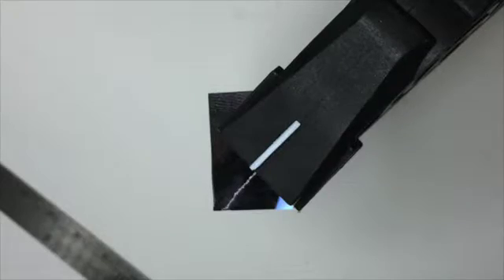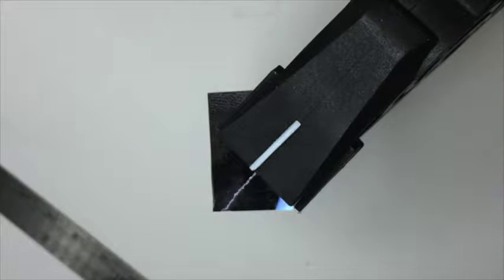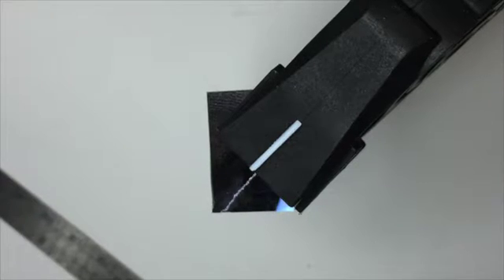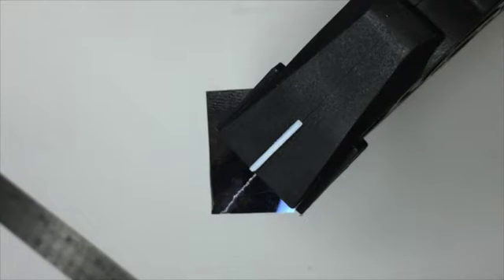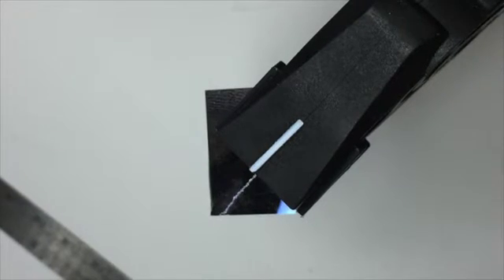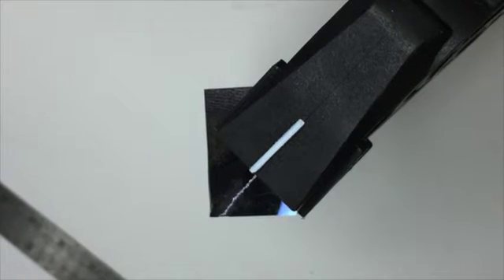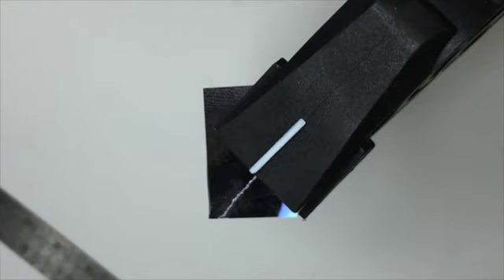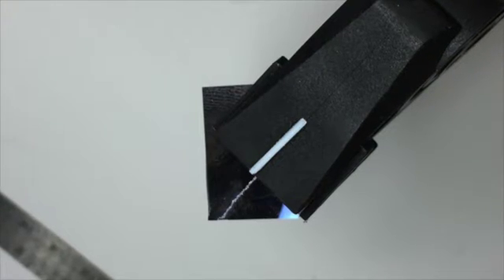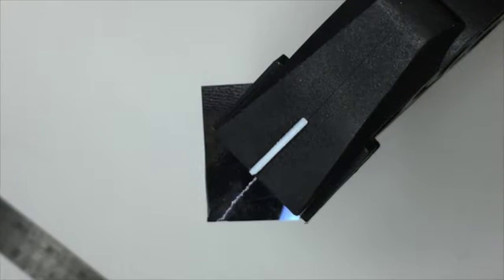It is also possible to cleave the sample using clean break cleaving pliers, or cleaving the sample over the actual diamond scribe on the flip scribe.